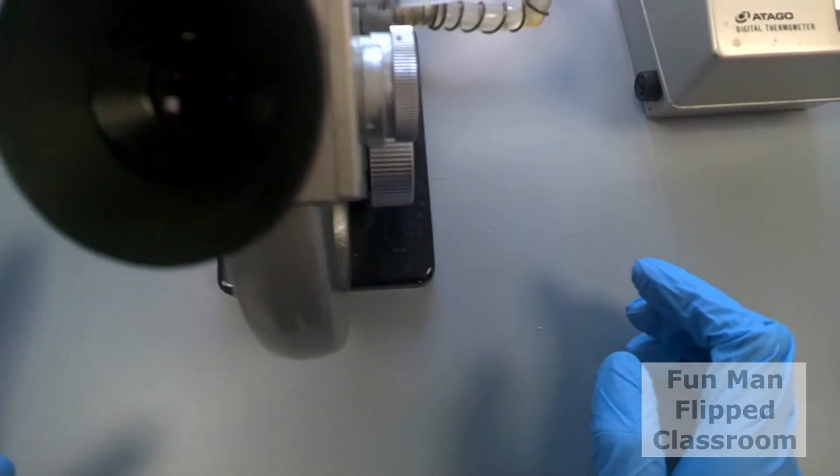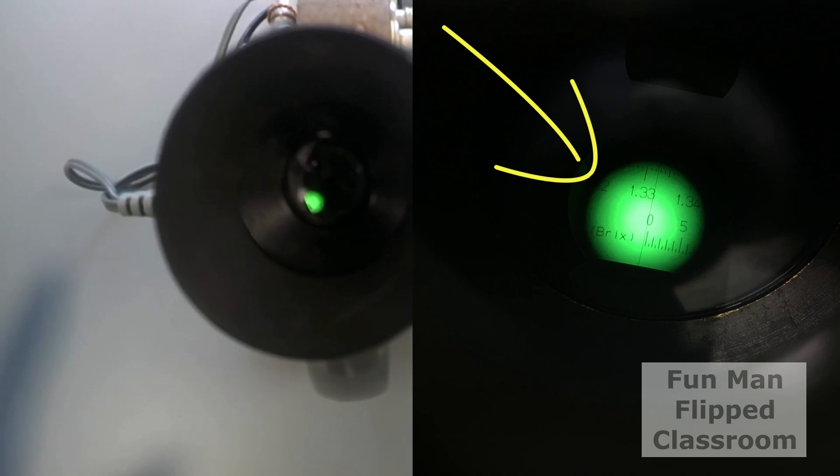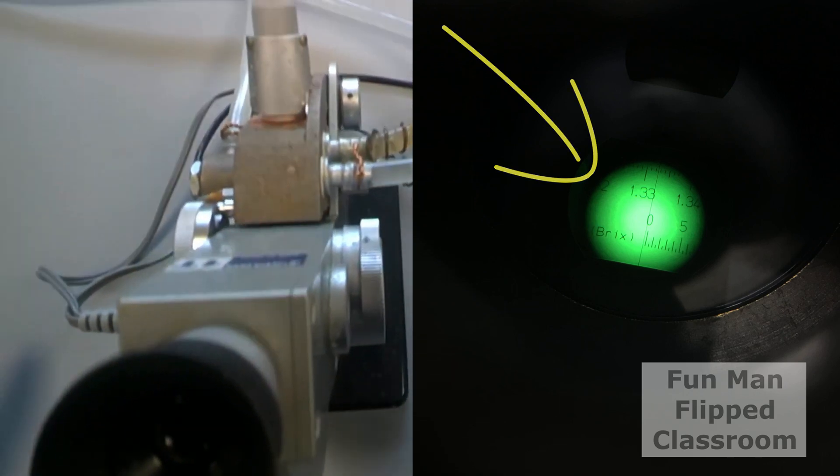This is the eyepiece where you will look into later. Notice the green circle? That's exactly what you will witness. Watch me.